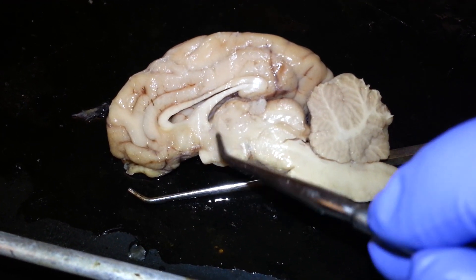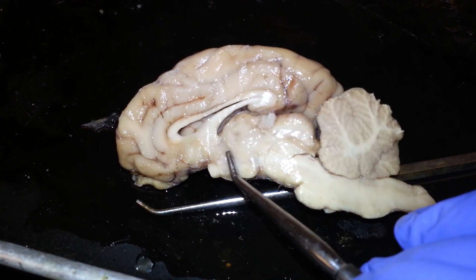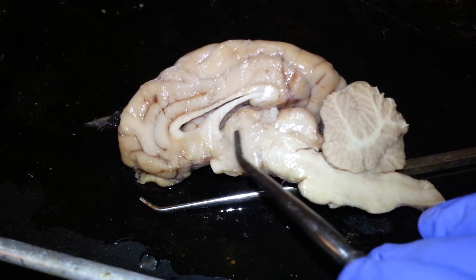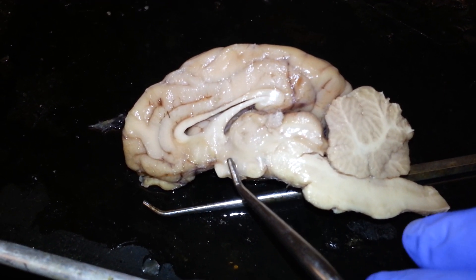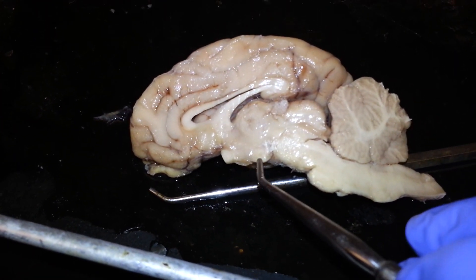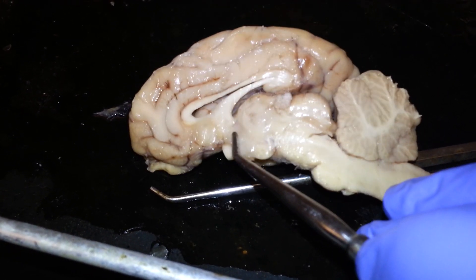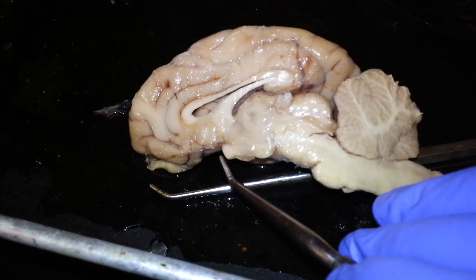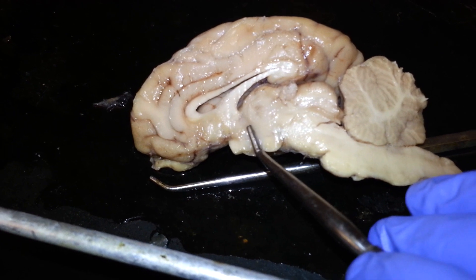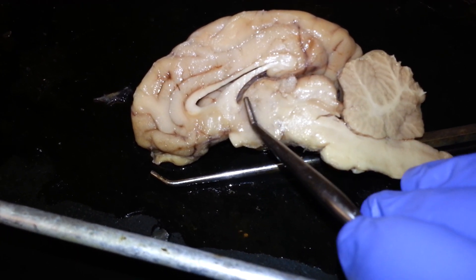Below, or inferior to the thalamus, you have the hypothalamus, which you can tell is the hypothalamus because it's the tissue that's below — hypo — the thalamus, or it's the tissue in between. See this round gland right here — the mammillary body — or the optic chiasm. So here you have the optic chiasm and the mammillary body, and in between the two is the hypothalamus, inferior to the thalamus.